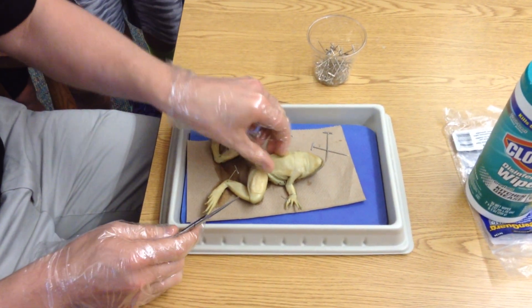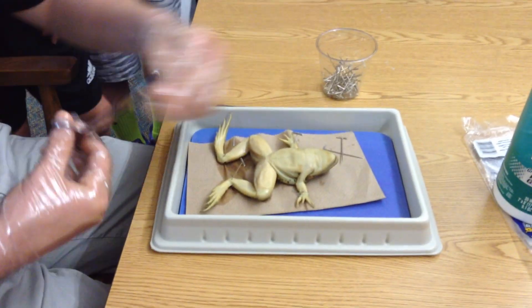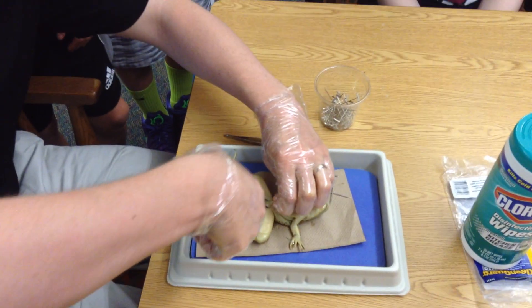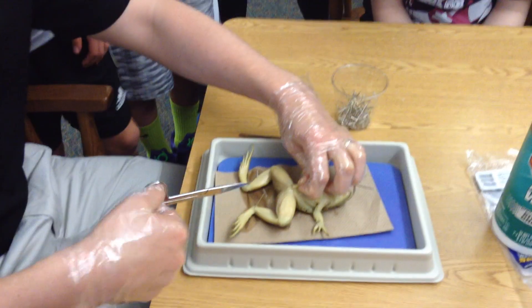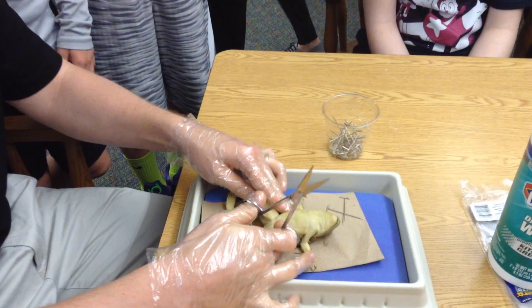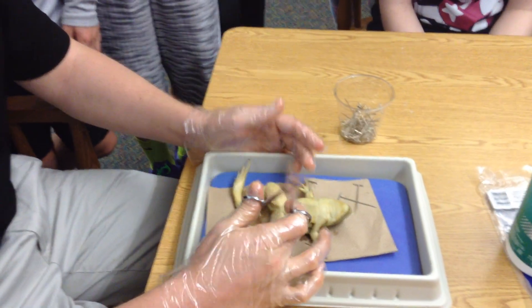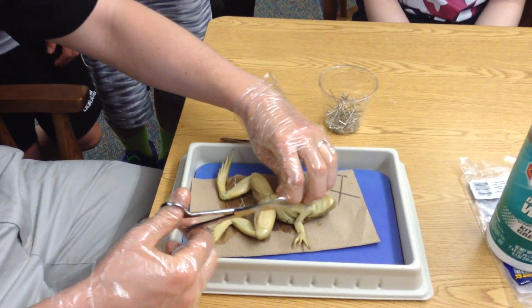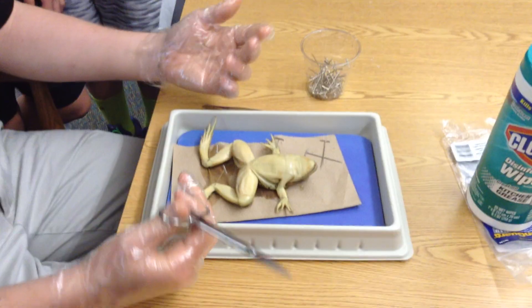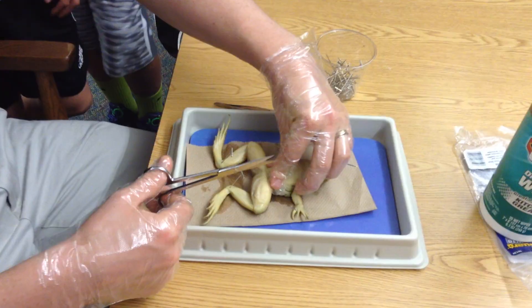There are two things here: you have this thin skin layer on top — you can kind of see it there. We need to get that skin out of the way first. So you start not too far down, not into the legs, but just above the legs a little bit. You start by making an incision, just down like that. Frogs are juicy, so I'm going to push some of that liquid out of there. Feel free to take a seat if you don't really want to see that — I've never had anybody have a problem, but it's just out there.